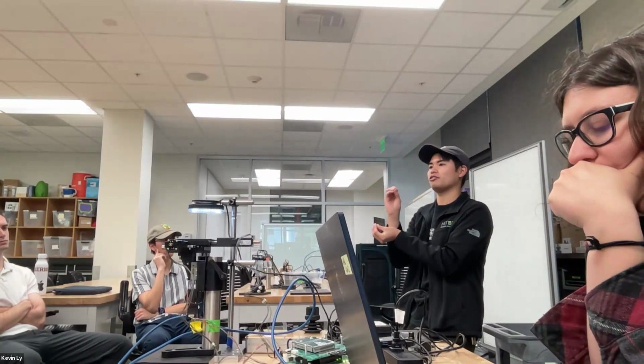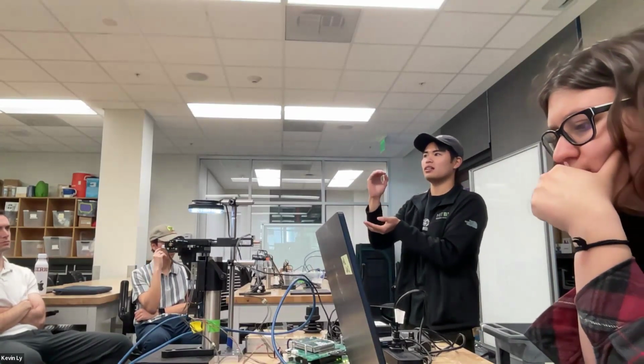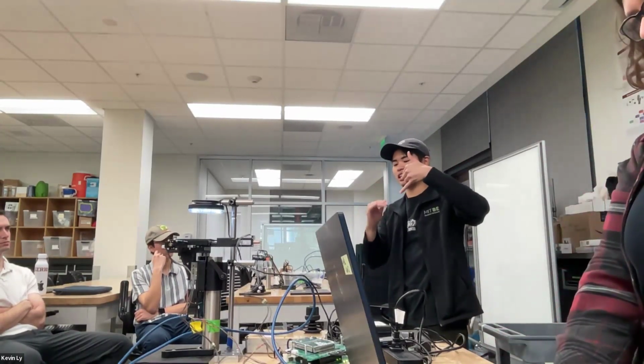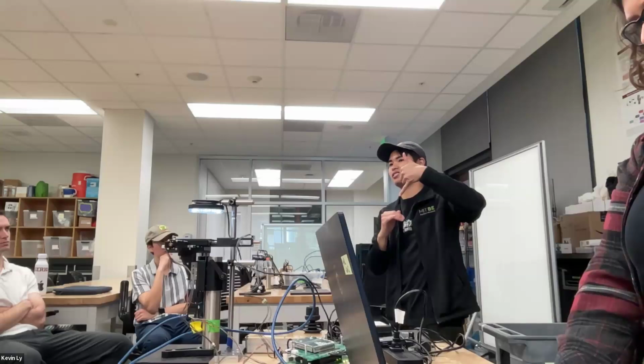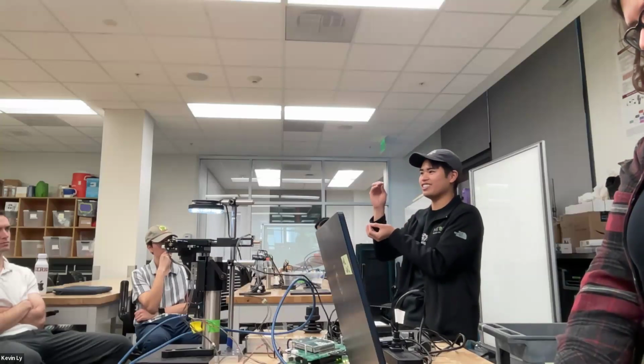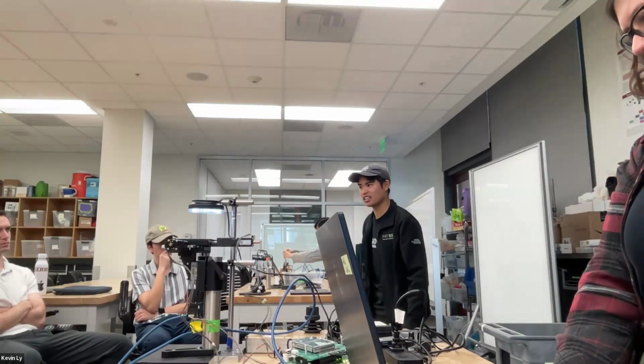So that gives you fine control over the focus, because at the end of the day, how far does the objective lens need to be from the object? It needs to be a focal length, right? So to get it precisely, you need big control, but you also need tiny control.